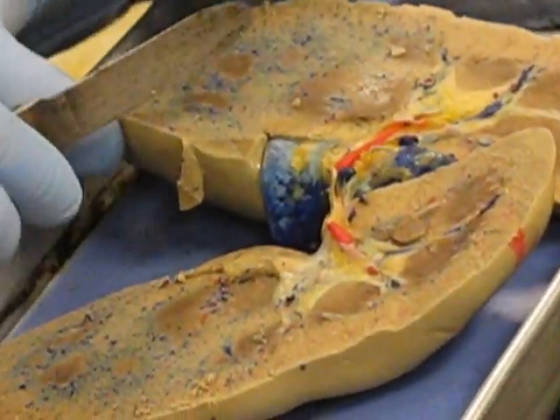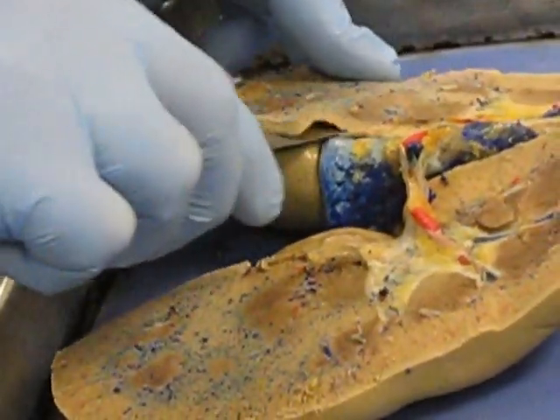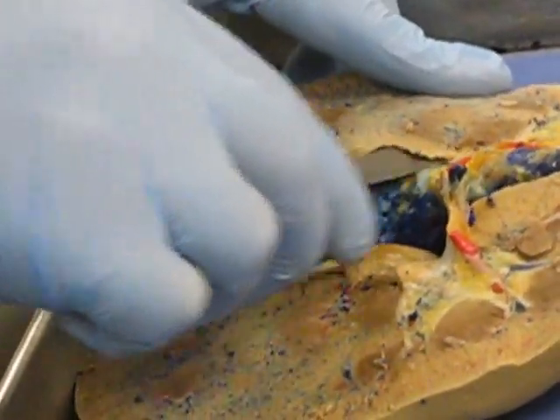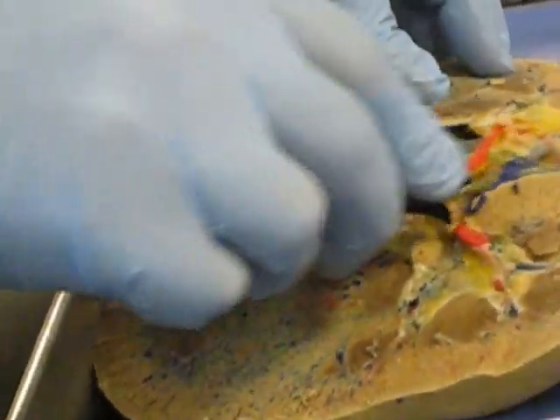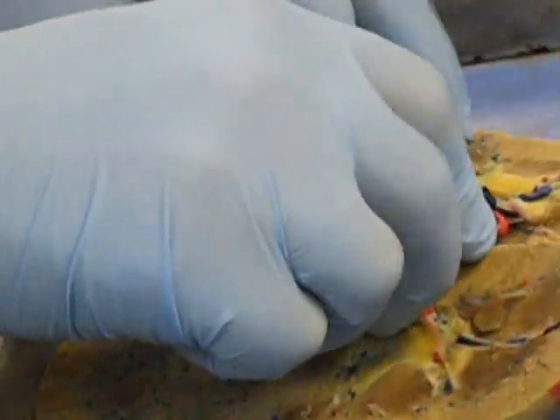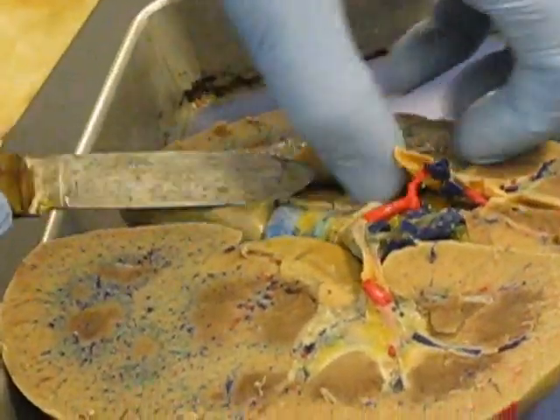I'm not really seeing the pelvis here — it's because I didn't cut the center. Let me shave another piece of this off, because you can actually open the pelvis up if you know where to cut. I've got a bunch more fatty looking stuff. I'm just going to shave this off right here.